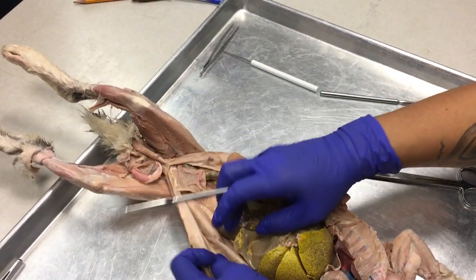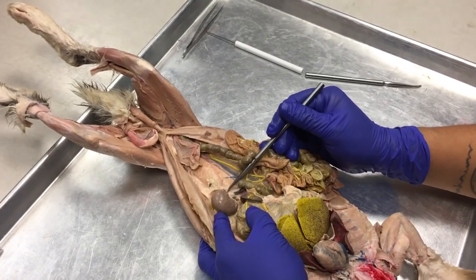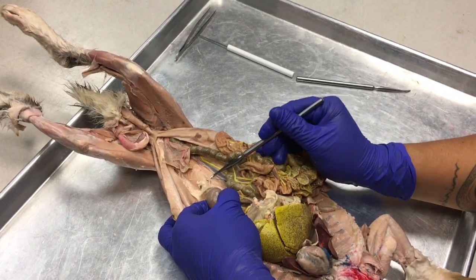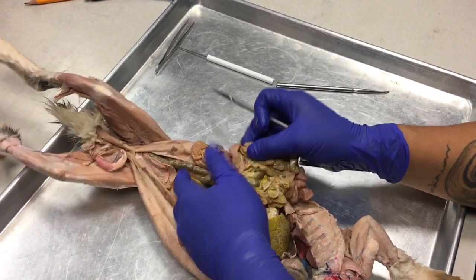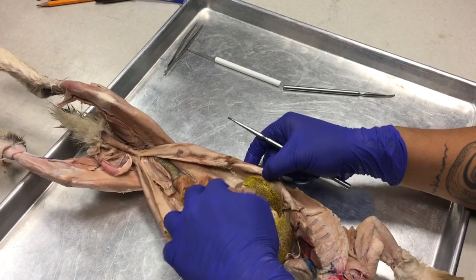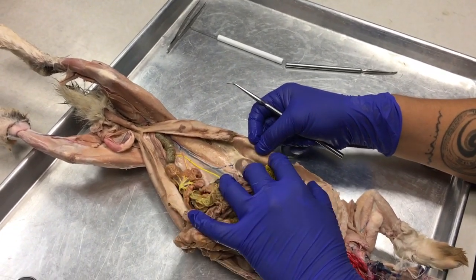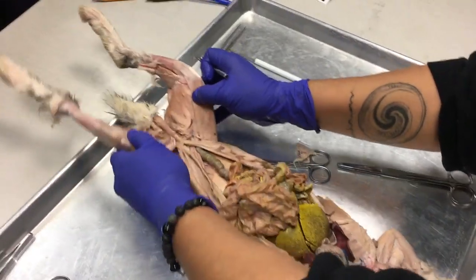Okay. And if we move all the organs to one side, we can dig out a kidney from the back and observe here the ureter that's going toward our urinary bladder. There's one on both sides, two kidneys. I didn't dig this one out though. Okay. And this is a boy.